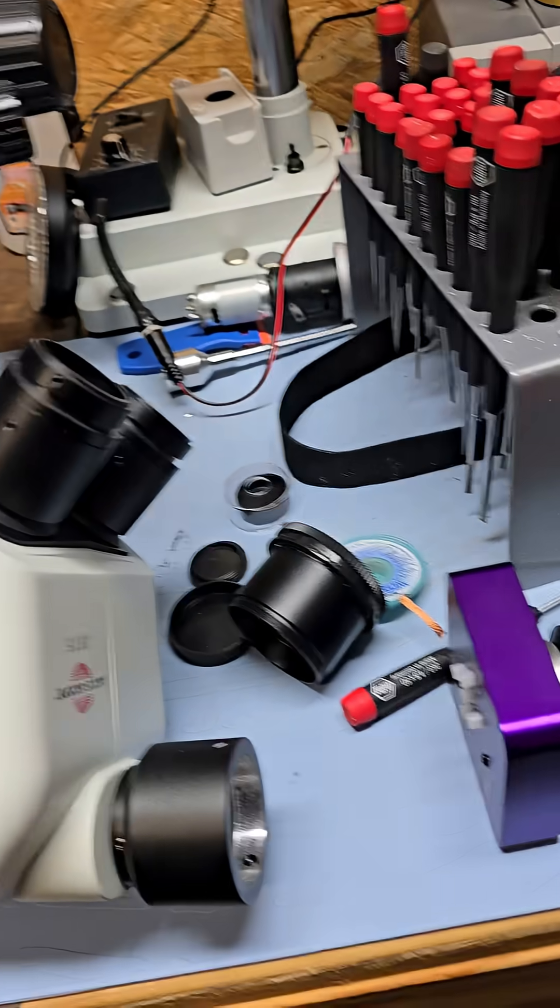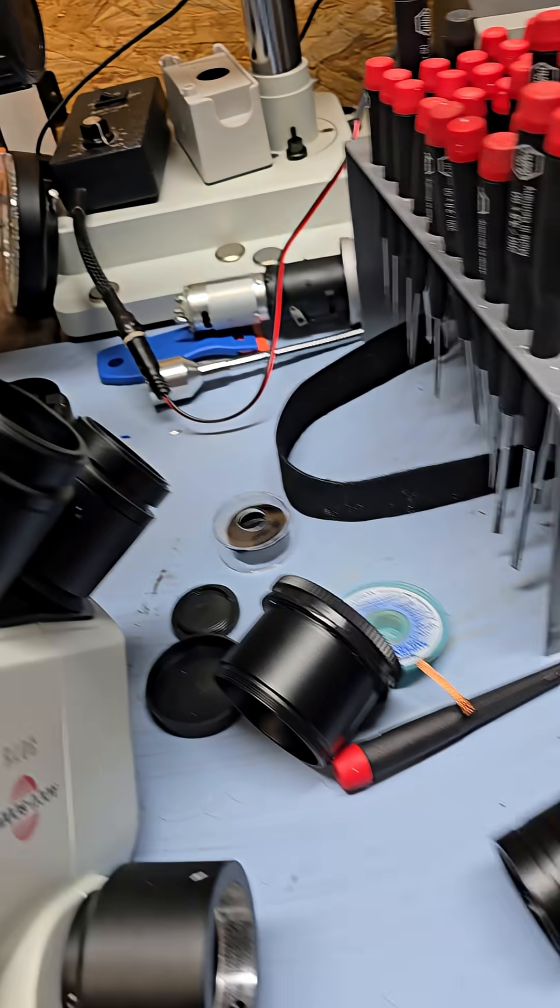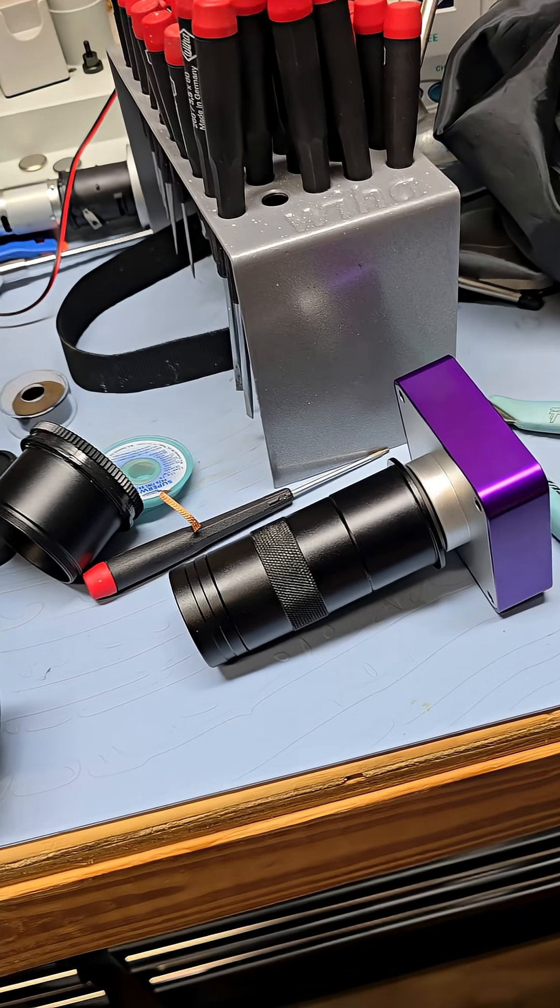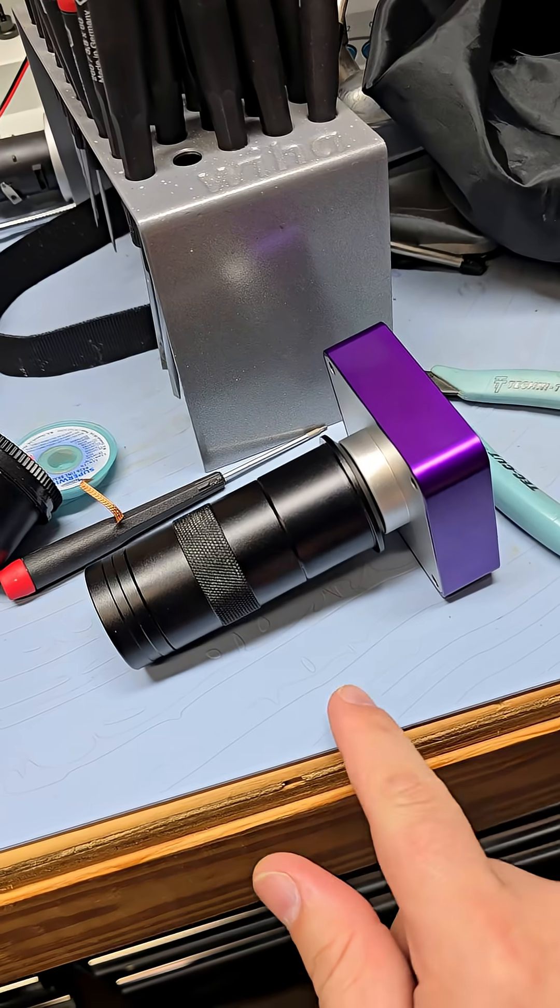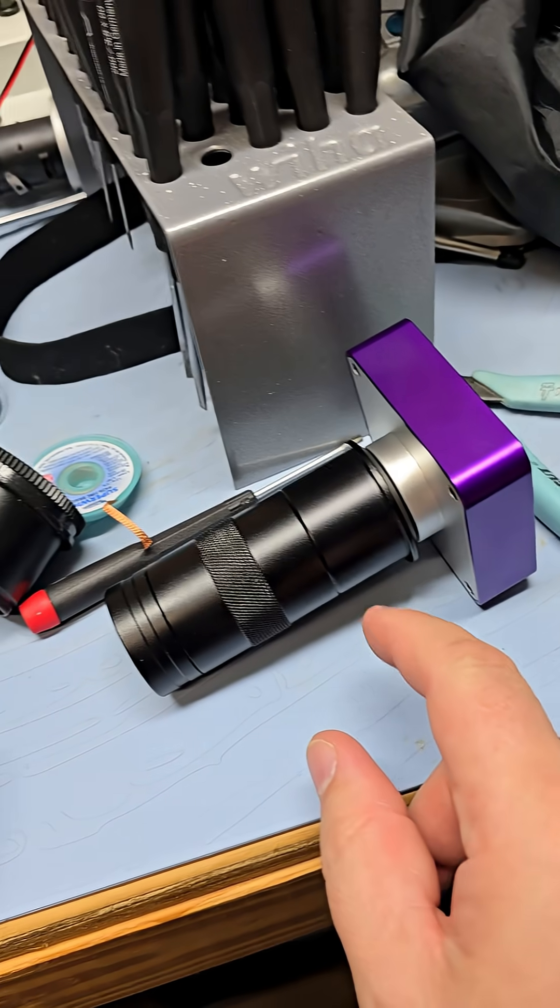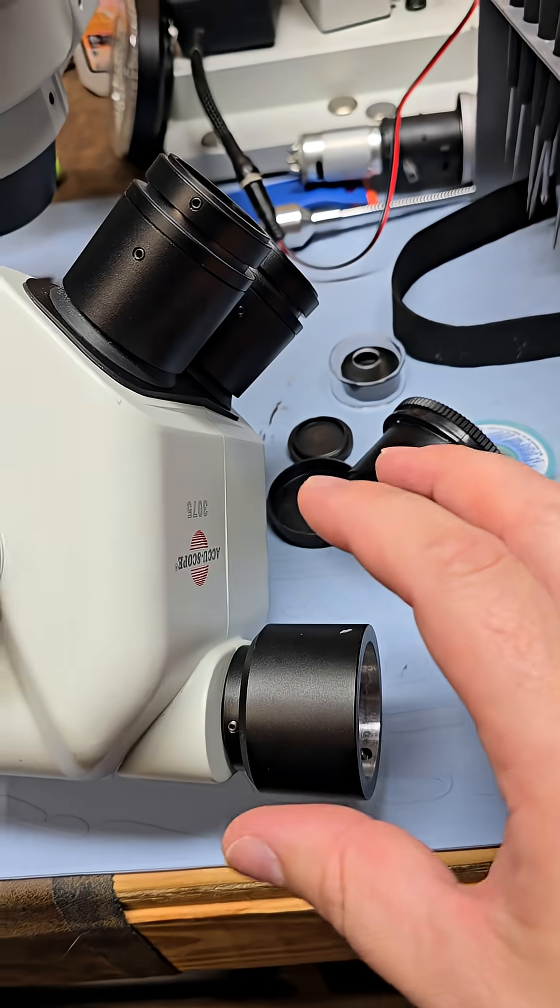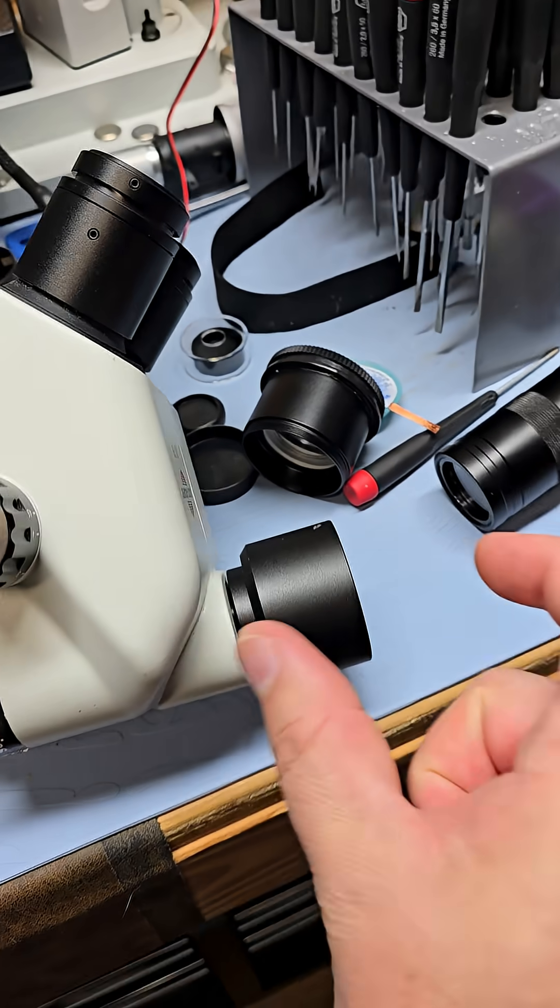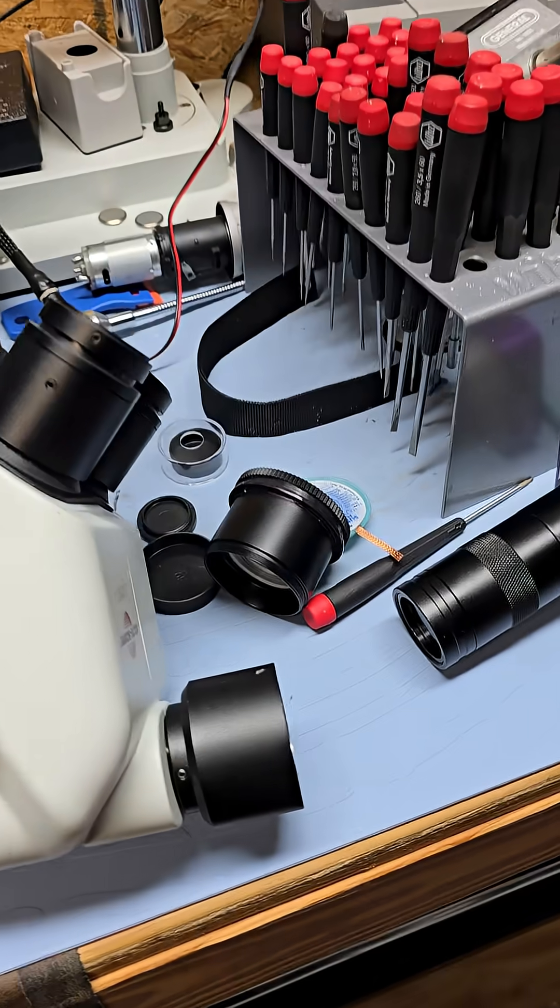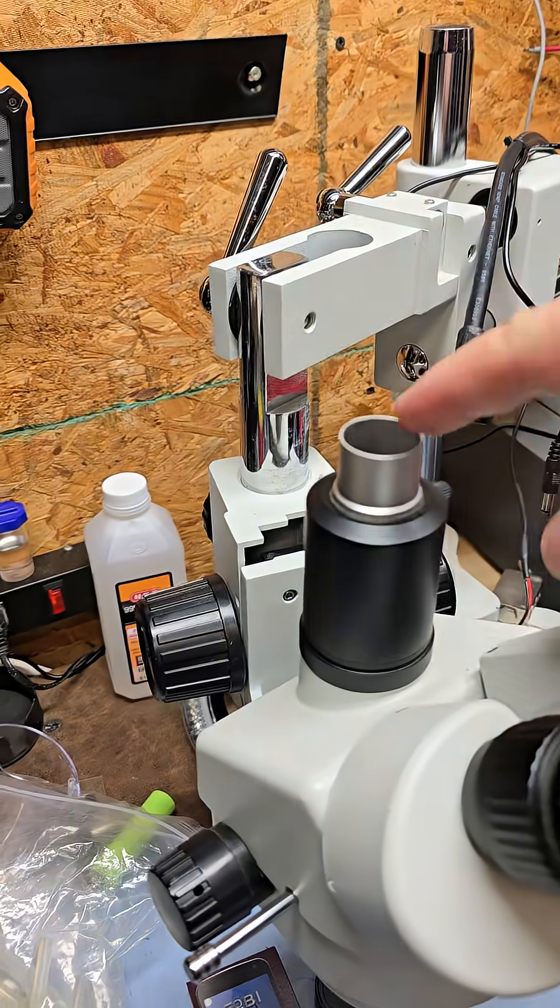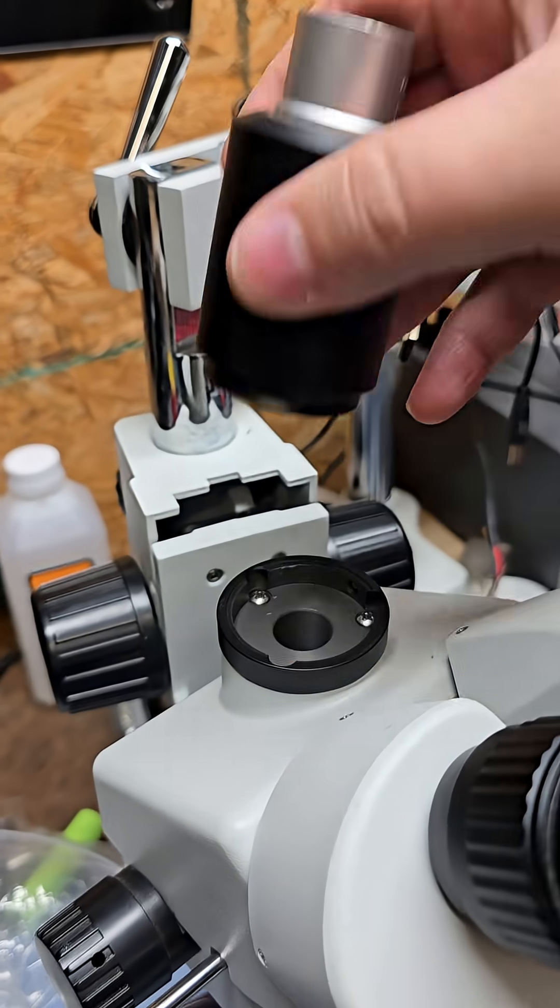However, C-mount seems to be different between various manufacturers of microscopes and it's the threaded fitting that allows different optics to sit on there. And as you can see, that is not C-mount, right?